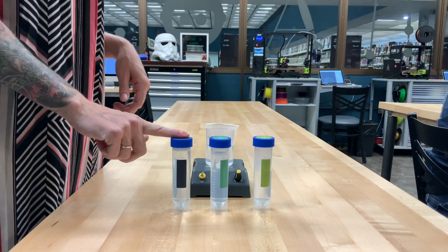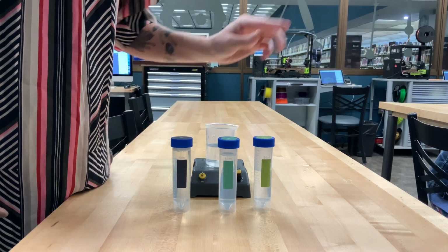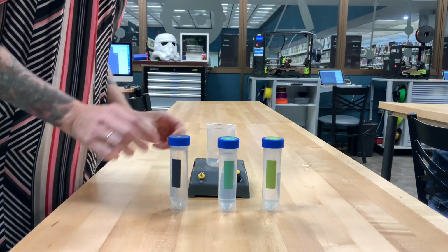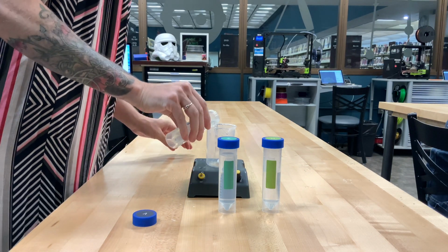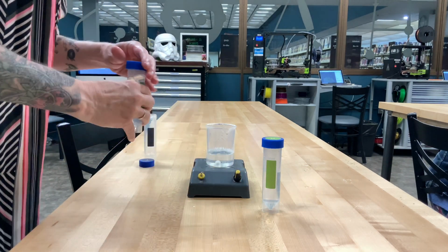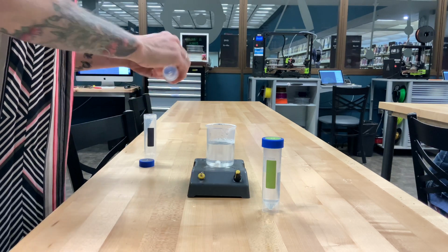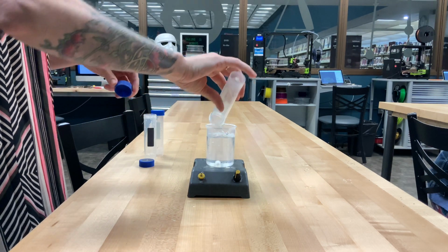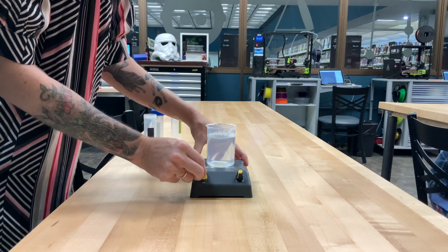So we have our iodide solution. This middle one has starch and hydrogen peroxide, and this last one is just some warm water. So we are going to pour these in order. First goes the iodide solution. Remember, that's iodine and ascorbic acid. Then we are going to pour in our starch and hydrogen peroxide mixture. And then we are going to add in just some more water. We're going to turn on our mixer to start our chemical reaction.